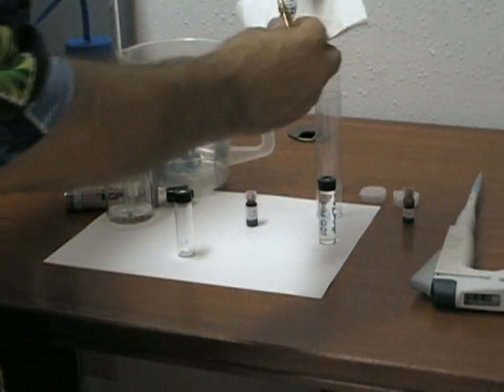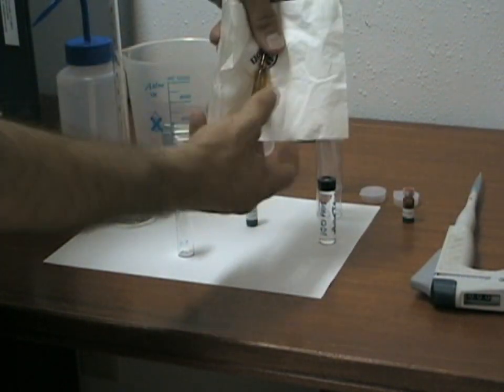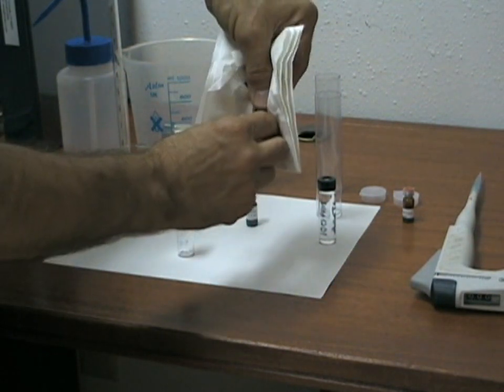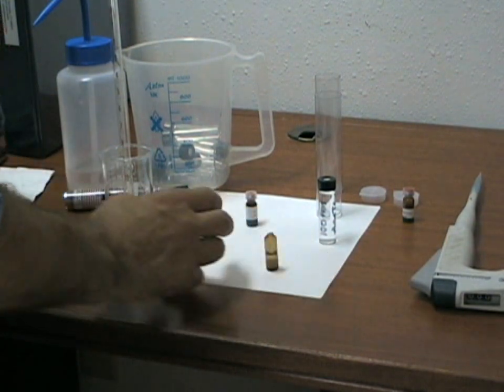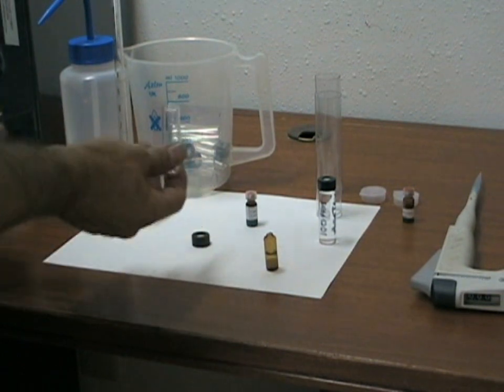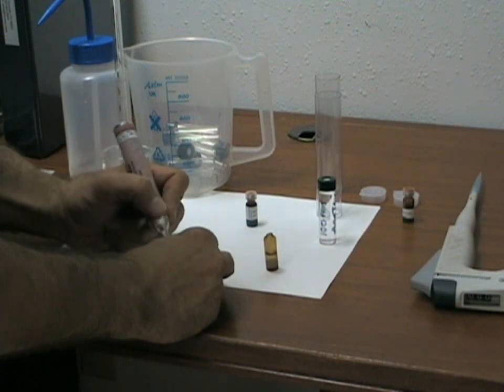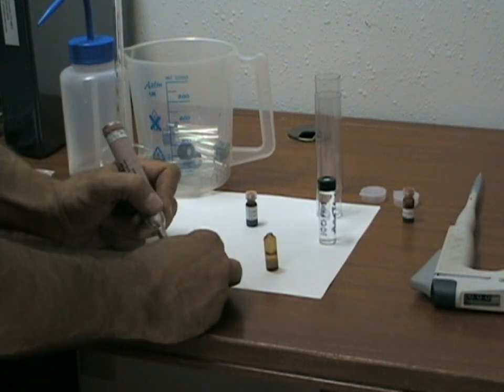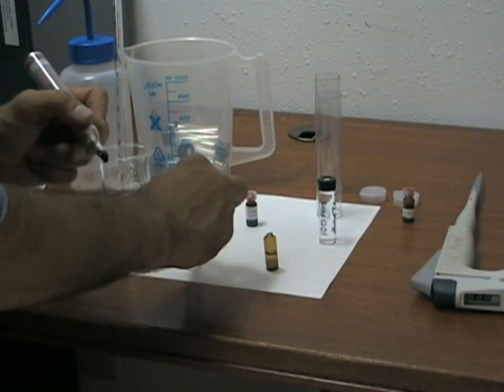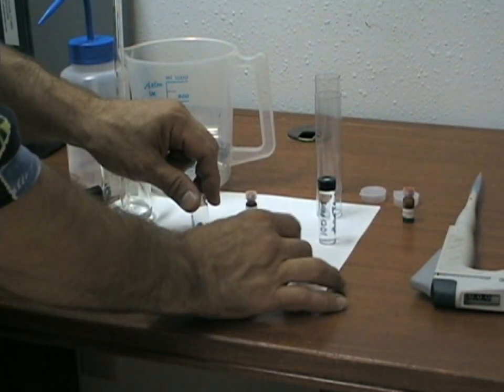Again, using a paper towel, tap it to make sure all the fluid is down low, snap the neck of the ampoule, and again mark the vial so you know that this is going to be a 100 ppm mixed standard of all the other alcohols, aldehydes, and ketones present in this material.